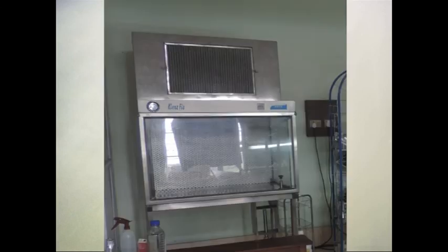The next is the use of laminar airflow cabinet. Laminar airflow cabinet with horizontal airflow from the back to the front and equipped with a Bunsen burner is the primary equipment used for aseptic manipulation. In the laminar airflow cabinet, air is drawn in by electric fans and passed through a HEPA or high efficiency particulate air filter such that sterile airflow through the working place flows in direct lines, that is laminar flow. The working surface is cleaned with 70% alcohol before starting any experiment.